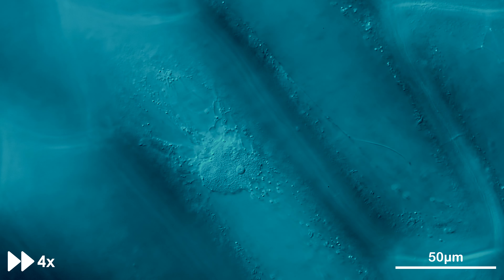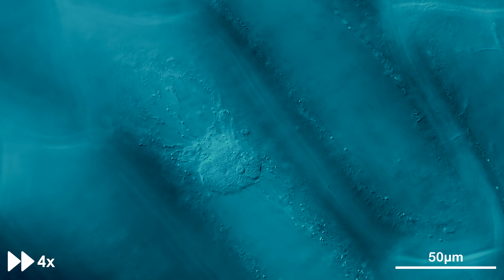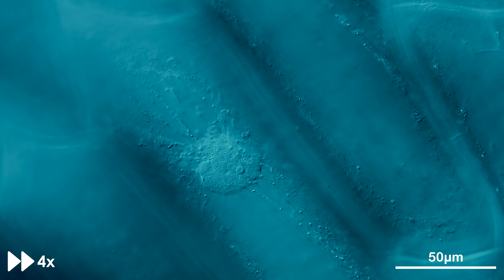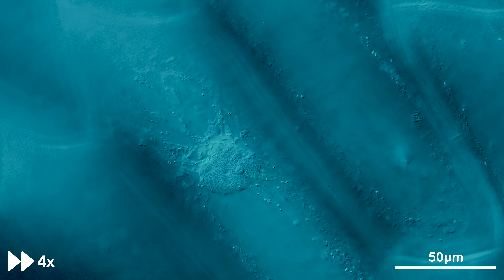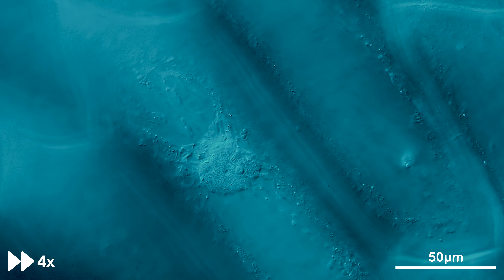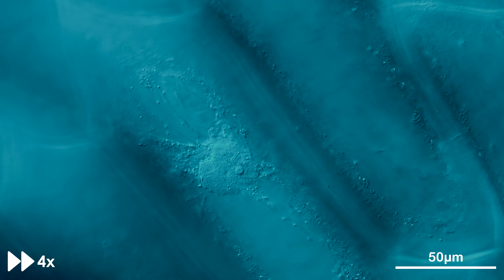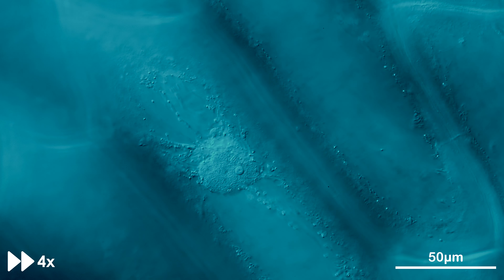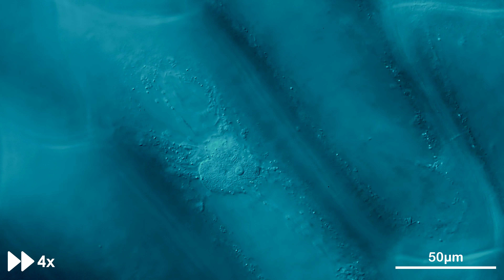We also have spherosomes for lipid storage and of course mitochondria. Here we have a focus on the nucleus of the onion cells and we can observe the cytoplasmic strands, which are reinforced by elements of the cytoskeleton to actively transport cellular components.